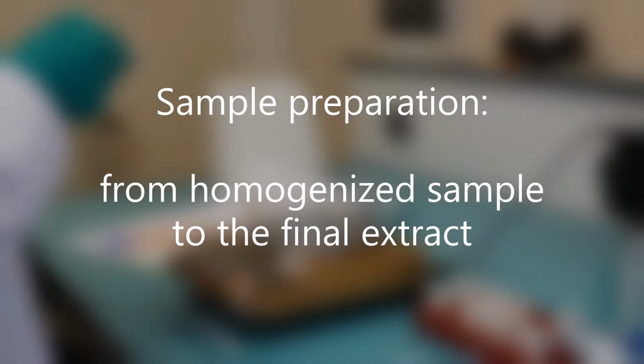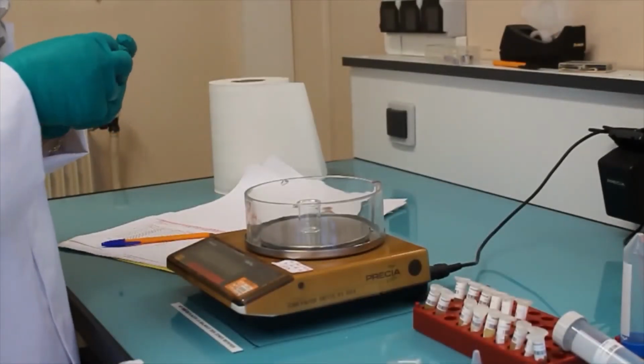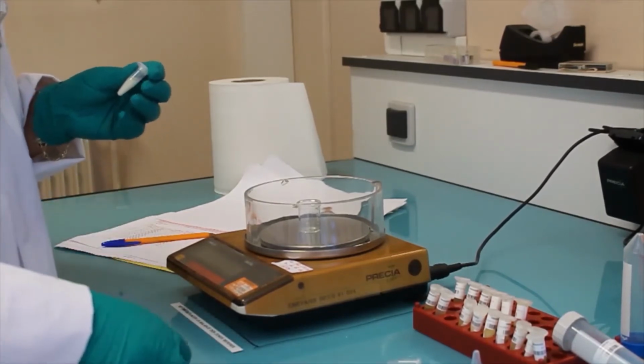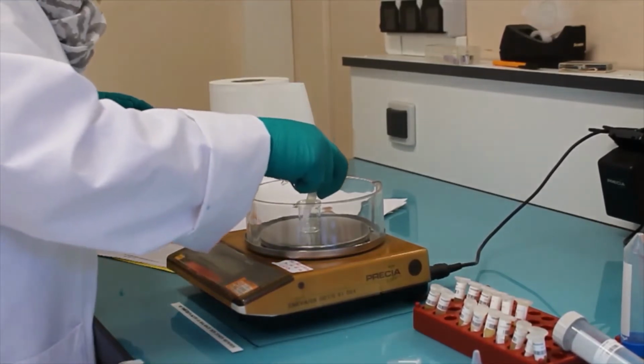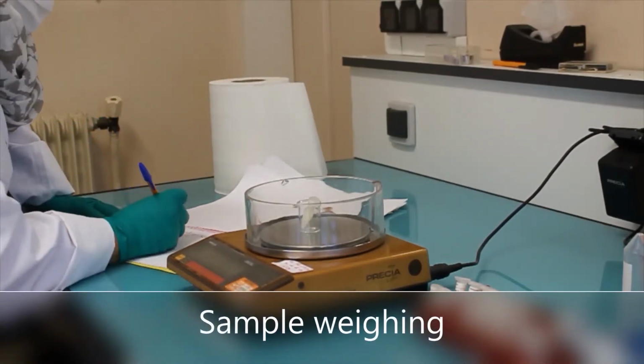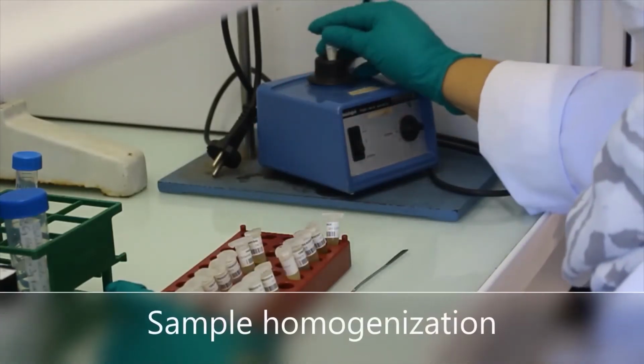The sample is first prepared for analysis. The procedure of the sample preparation consists of the following steps. First of all, the sample is weighed and then homogenized on vortex.